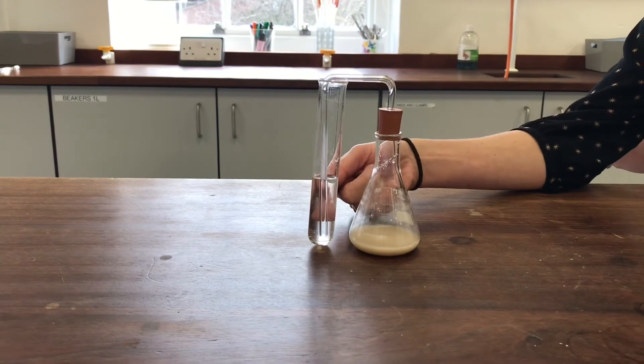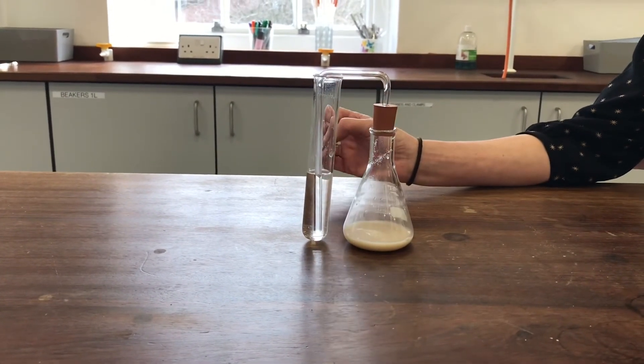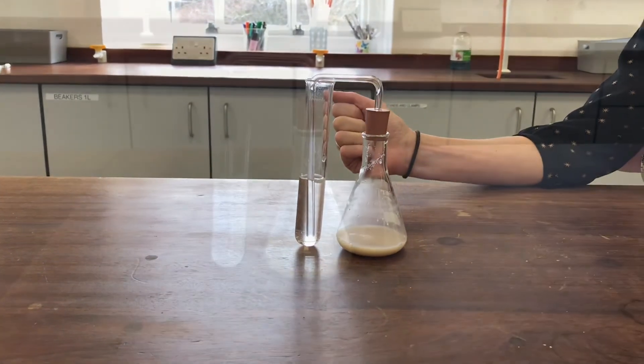So really what we're looking for is evidence that CO2 is coming off and that's why the lime water's there. So we'll come back a bit later when it's had a chance to work for a while and see if our lime water's gone cloudy.